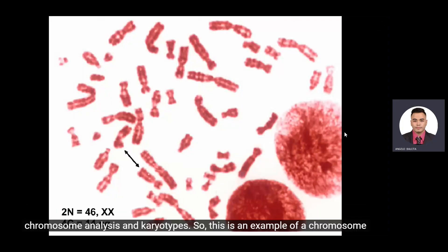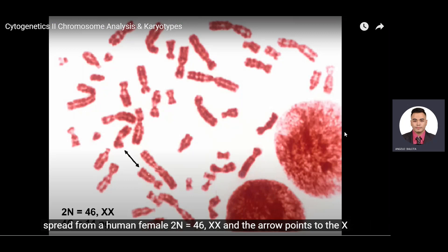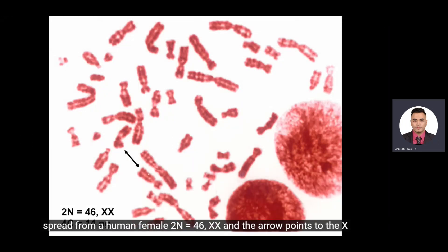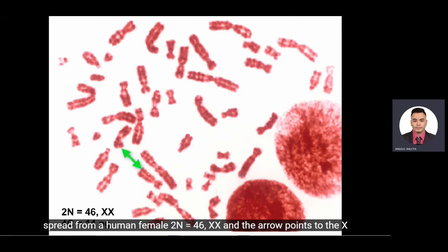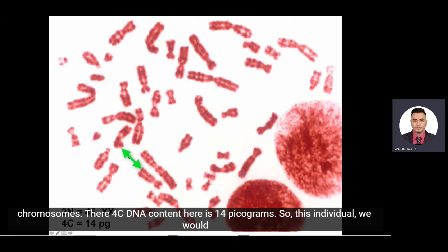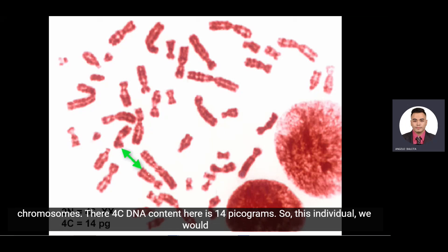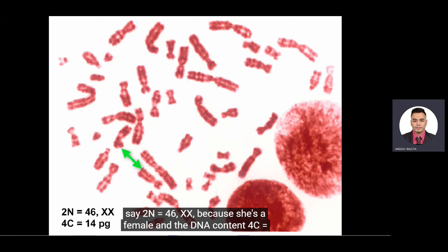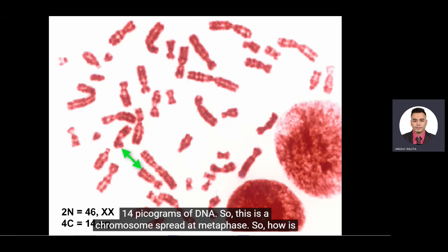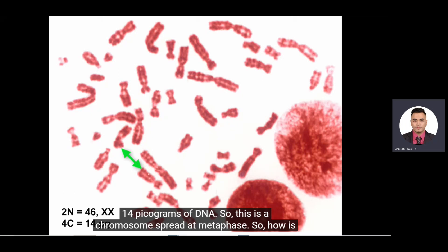This is a chromosome spread from a human female, 2n equals 46 XX, and the arrow points to the X chromosomes. The 4C DNA content here is 14 picograms. So this individual we would say 2n equals 46 XX because she's a female, and the DNA content 4C equals 14 picograms of DNA.